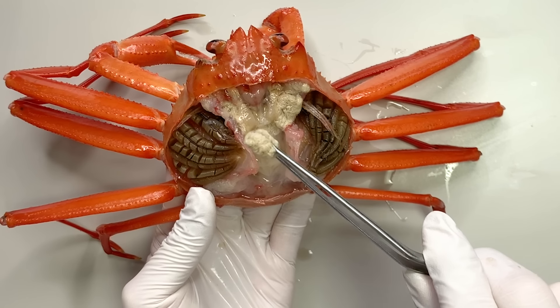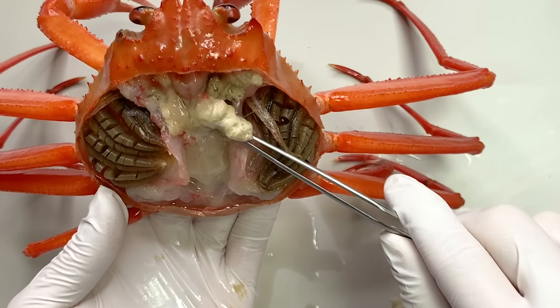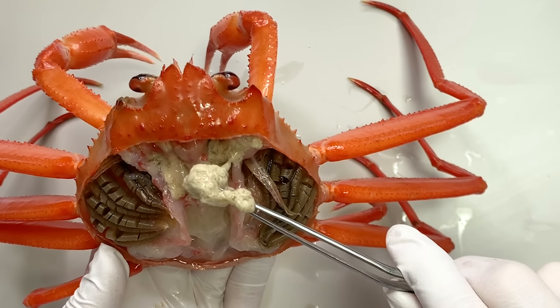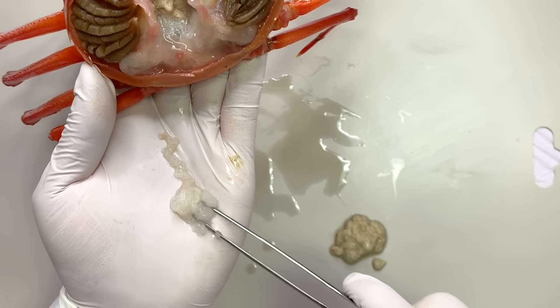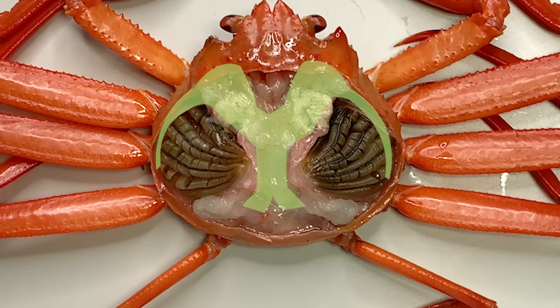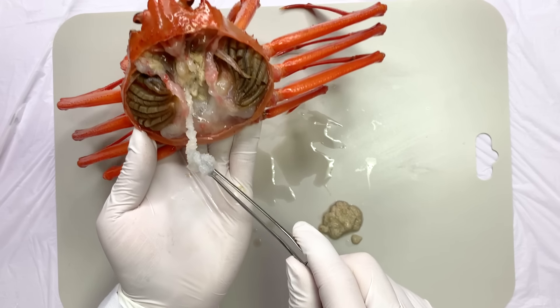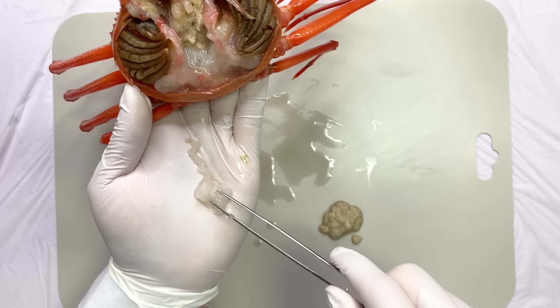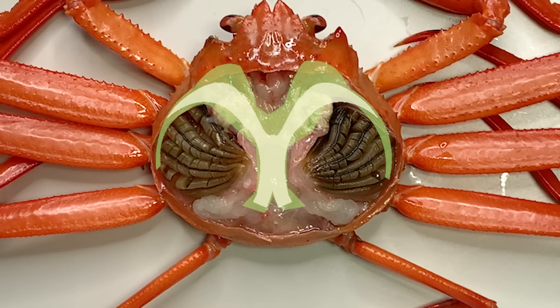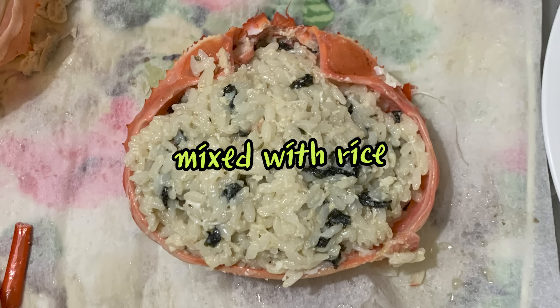Moreover, the inside of the crab's carapace is filled with strange organs. If you look closely, there are structures with a slight greenish tint, and others with a white coloration. The ones with a greenish tint are called the hepatopancreas, which is a digestive gland in arthropods. The hepatopancreas is positioned within the carapace. The white structures are the crab's gonads, which are located near the hepatopancreas. In certain Asian cuisines, the hepatopancreas and gonads are considered delicacies.